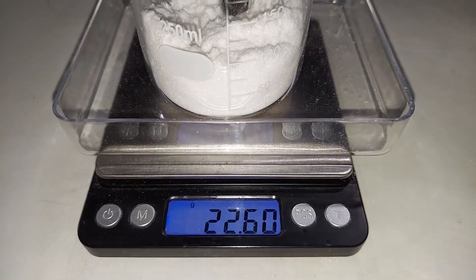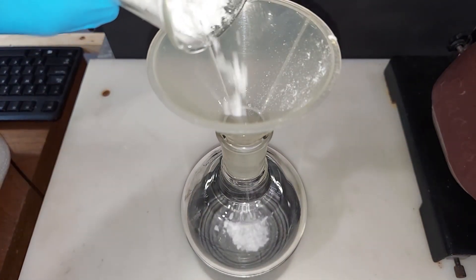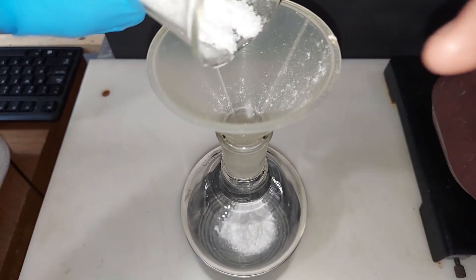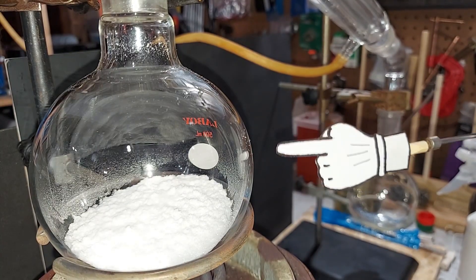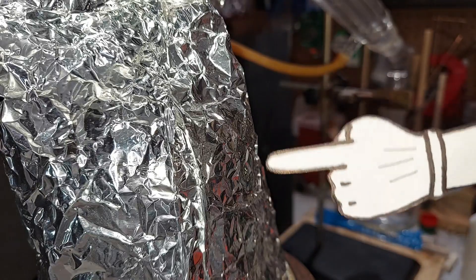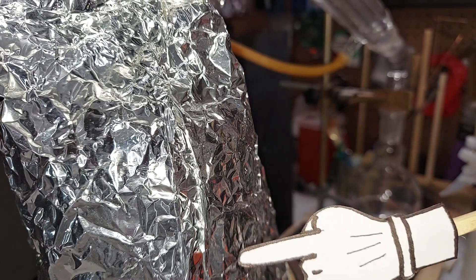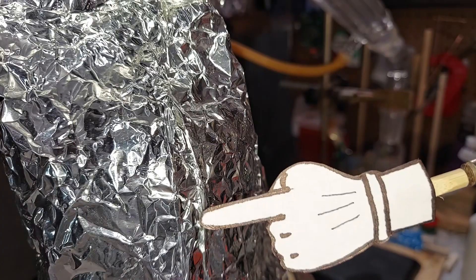We got 22.6 grams of salicylic acid out of 100 aspirins. To start the distillation, I'm adding the salicylic acid to a 500-milliliter round-bottom flask. We're going to heat up the salicylic acid, driving off the carbon dioxide. The phenol that's left will come over in the distillation and end up in the small flask. To help increase the temperature inside the round-bottom flask, I've covered it with aluminum foil to keep the heat inside.